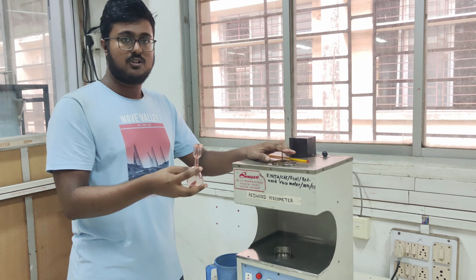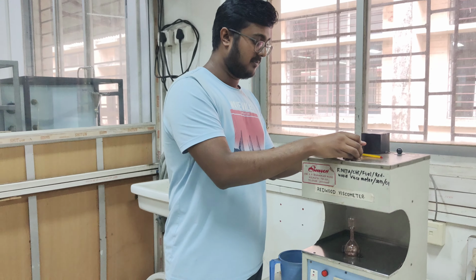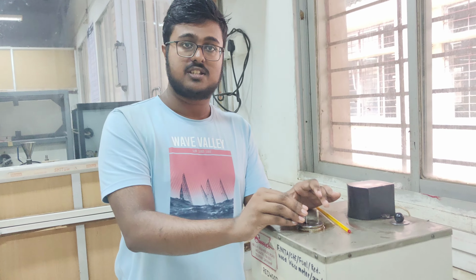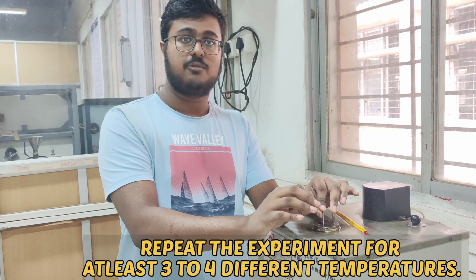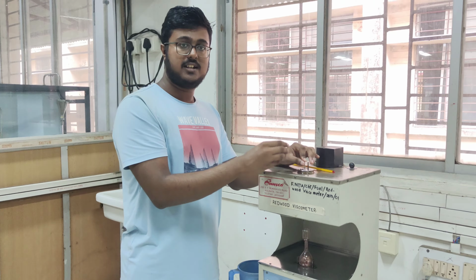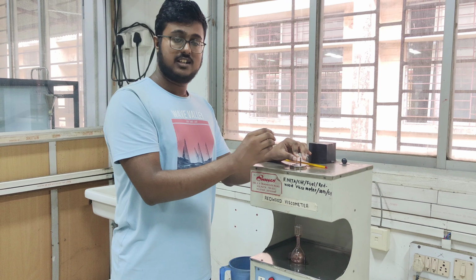Now we have transferred all the liquid sample into the oil cup, and we will again close the lid and make sure that the ball valve is covering the orifice opening. For the next few observations, we will take readings at a temperature higher than room temperature, so as to show that at high temperature the viscosity of a fluid sample decreases.